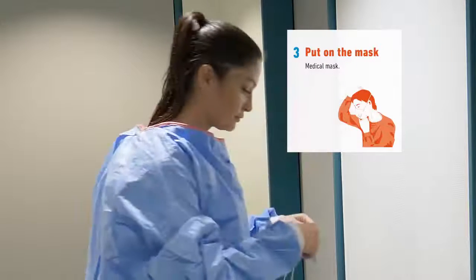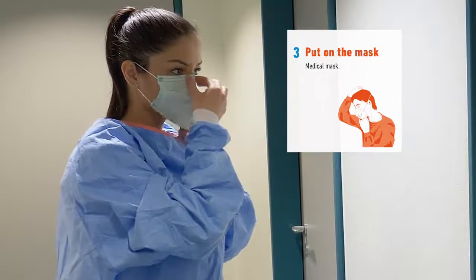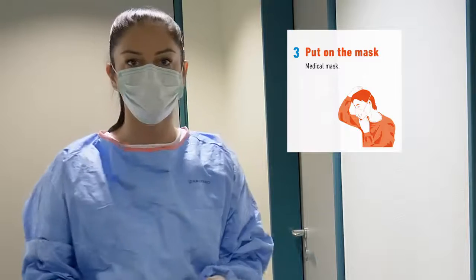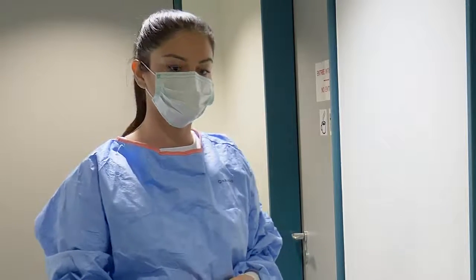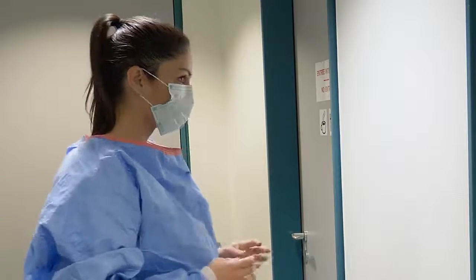Next, place the medical or surgical mask and ensure it is over your nose and mouth. You can pinch the metal piece to ensure a tight fit around the nose. Try not to touch the mask once it is secured on your face, and if you must do so, perform hand hygiene before and after touching the mask.